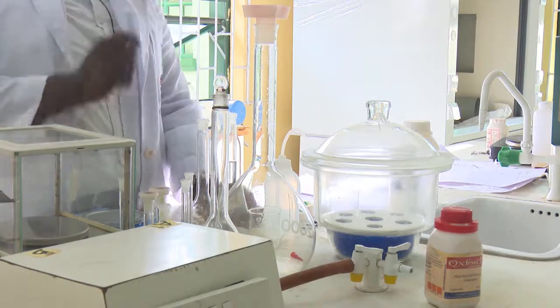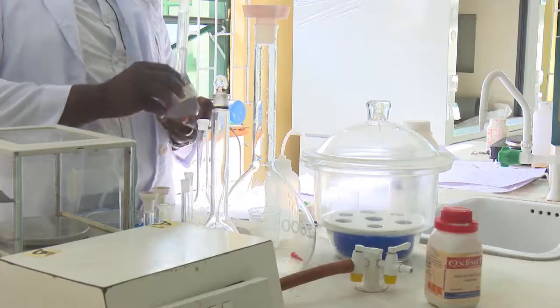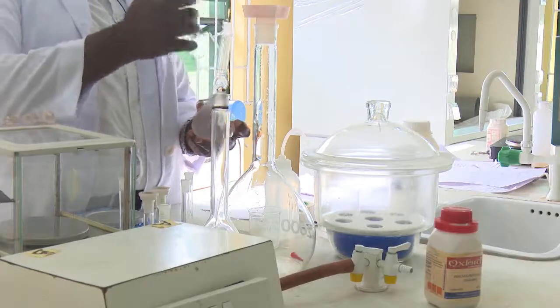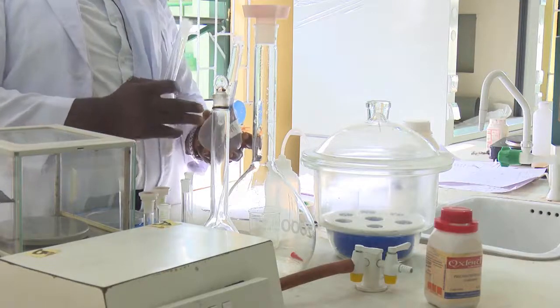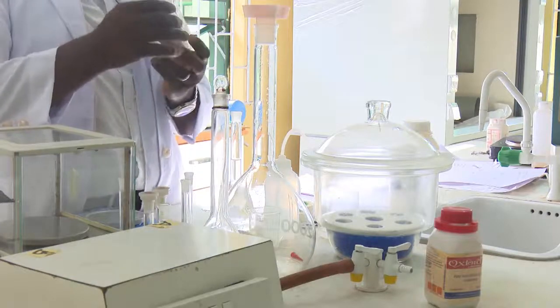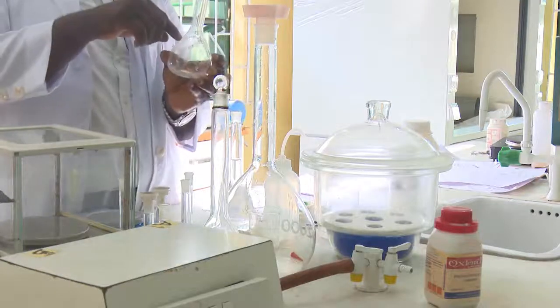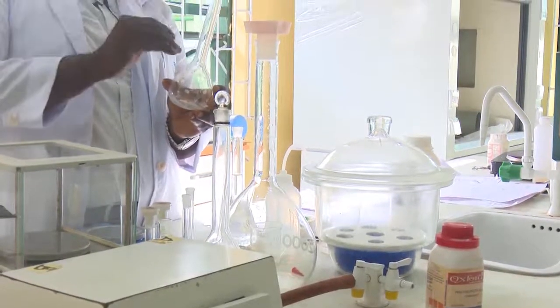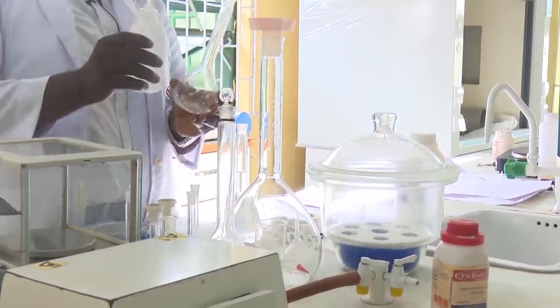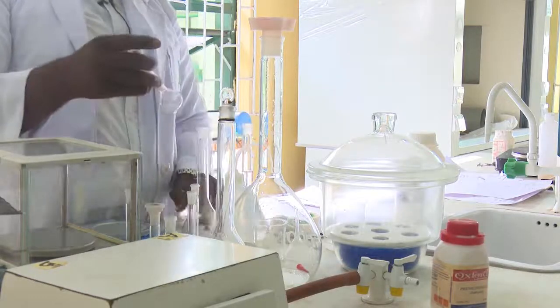What does that mean? It means that for your 1 molar sodium carbonate, you need 25 cm³ out of this initial solution to prepare your next solution of 0.1 molar, by taking the 25 and mixing it up, adding water or deionized water to the mark, which will give you your 0.1 molar concentration.